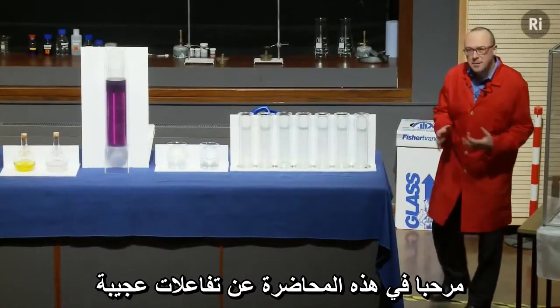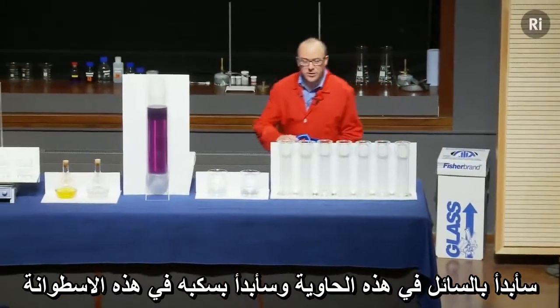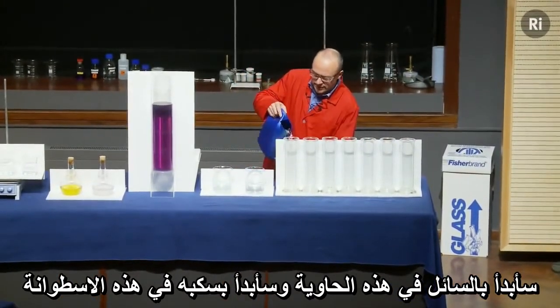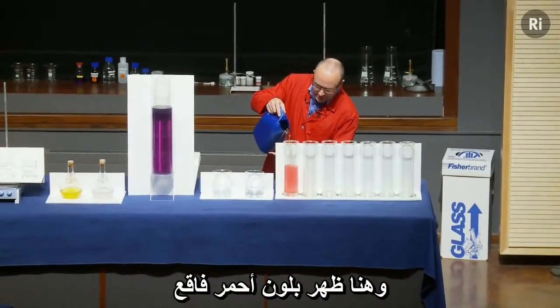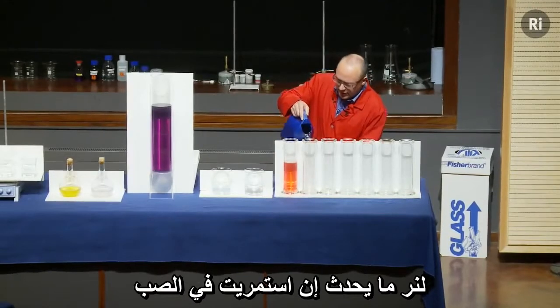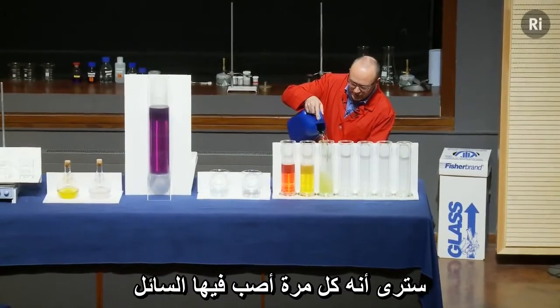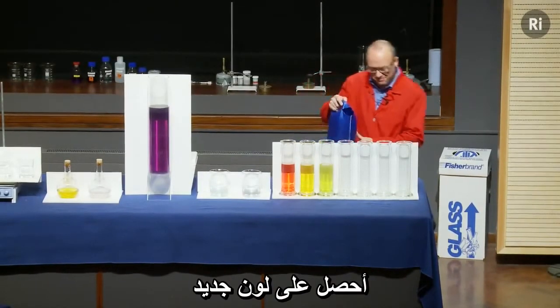Welcome to this lecture on chemical curiosities. I'm going to start with the liquid in this container and I'll just pour some into this cylinder. You can see it's a nice bright red colour. Let's see what happens if I keep pouring. Every time I pour out the liquid I seem to get a different colour.